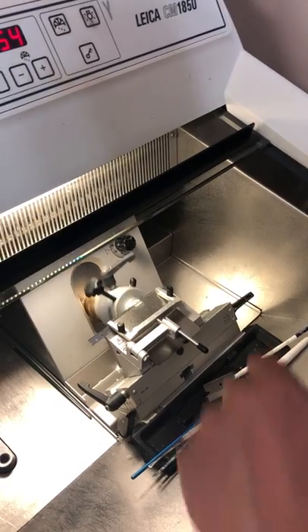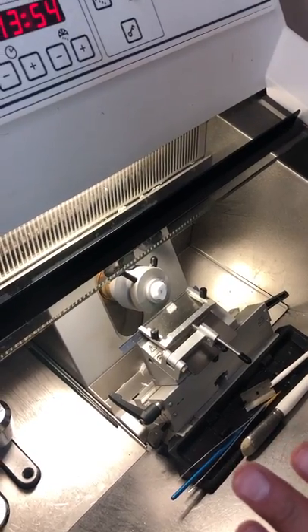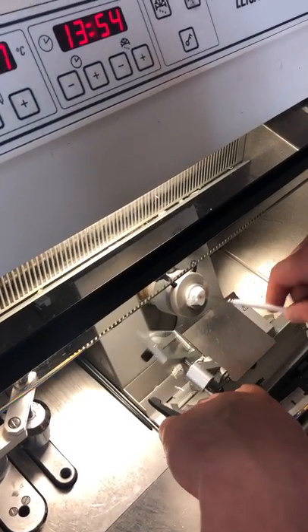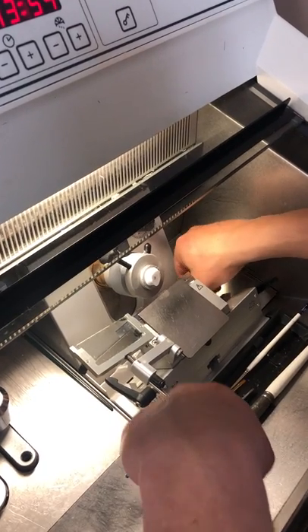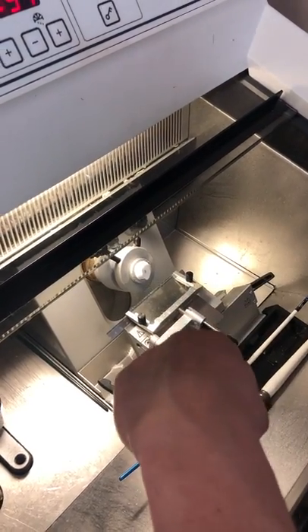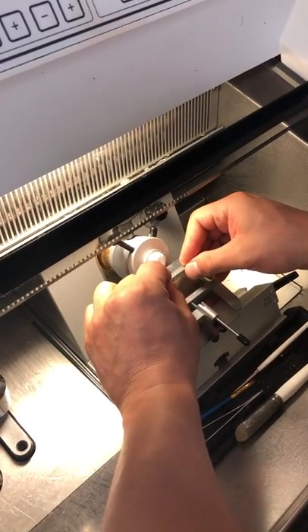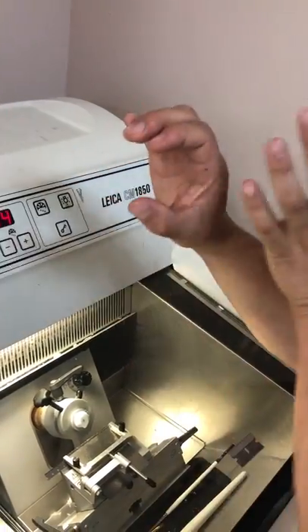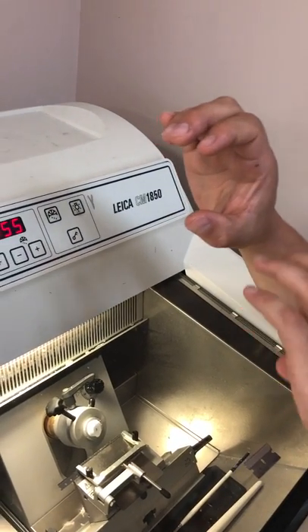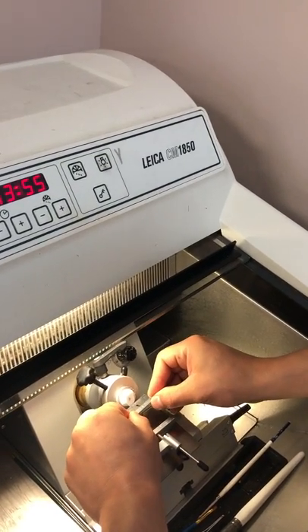Let's see what we have. It's not bad, but we can make it better — it's not working pretty well. We need to make a better shape. So you close this, go up, and try to block this thing. What we want is to have the C. It's not necessary to have a lot of space this way, but it's better to have a lot of space this way. I'm going to try to go for that — we want something more straight here.